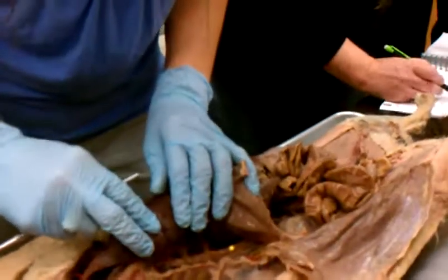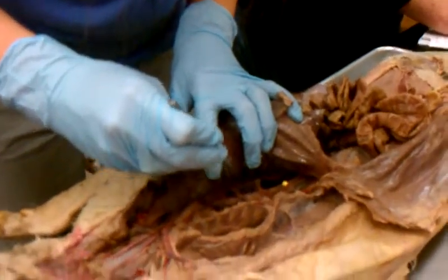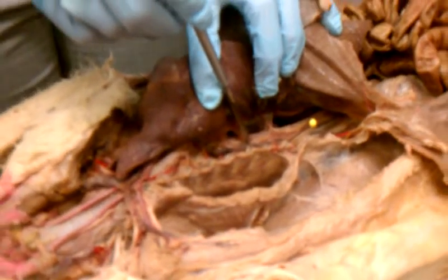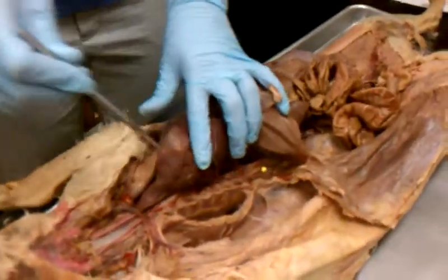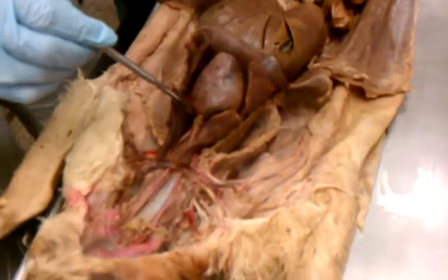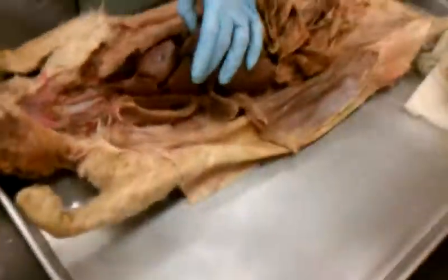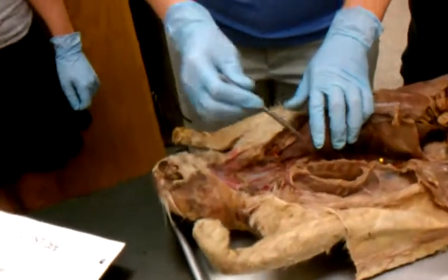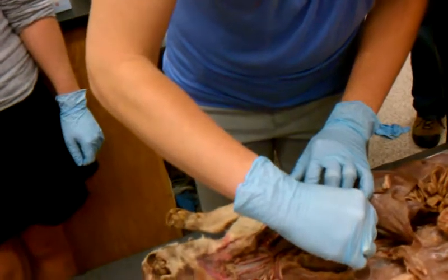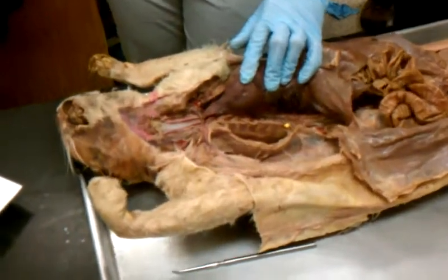Is that why you had that line drawn on your picture? That's the diaphragm? Yes, that's the diaphragm. It's right here. That's your thoracic artery. Aorta. Does that make sense? So if I'm looking for just the aorta, I'm going to pin it up here. If I'm looking for the structure of the artery, that's the aortic arch. If I'm looking for the thoracic aorta, I will pin this back and pin it down here, kind of like where this pin is. Except I'd watch out for the bones. That worked for everybody.